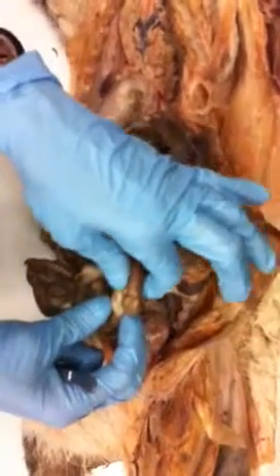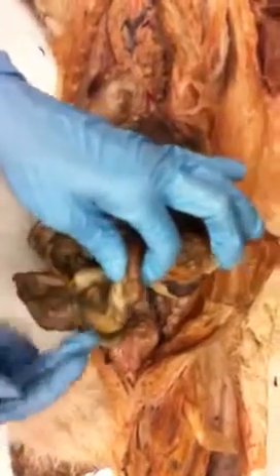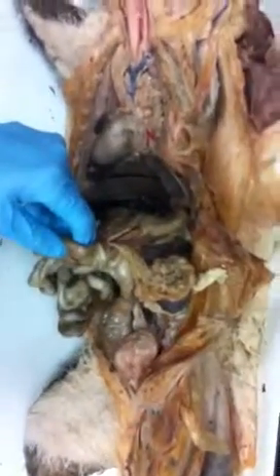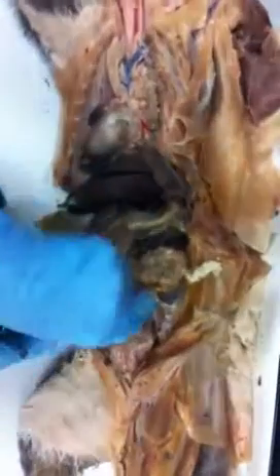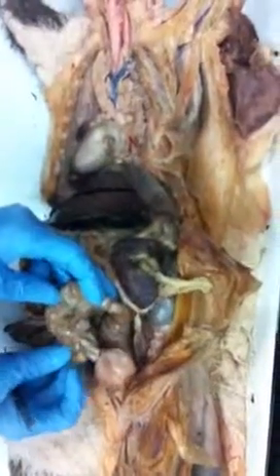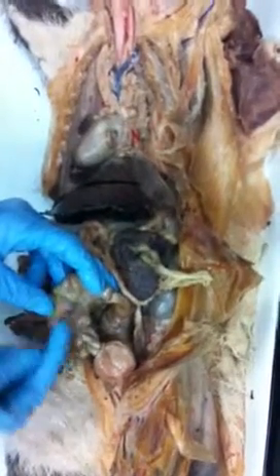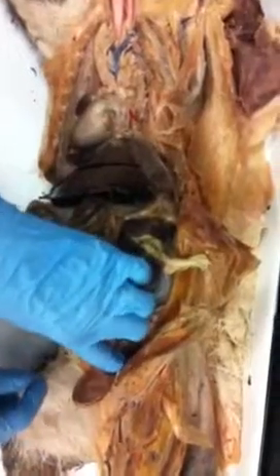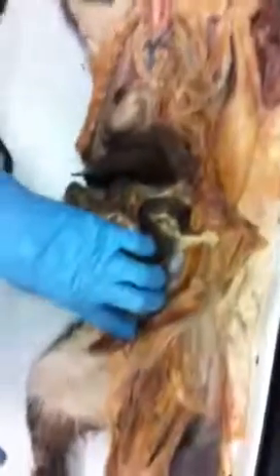Okay, there's also a valve, the ileocecal valve, right here that regulates flow from the small intestines to the large intestines. Okay, the function of the large intestine is to reabsorb water. And if we could put this in the proper orientation, it would be something like that. So this would be your ascending, your transverse, your descending. Okay? And then that all comes down here, way down in here, and that's the rectum for storage and compaction of the waste prior to elimination.